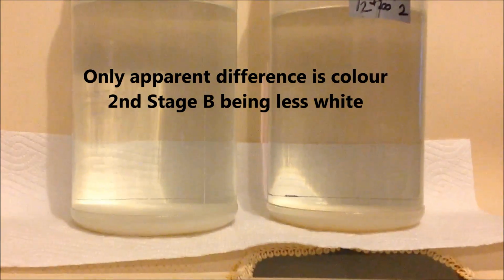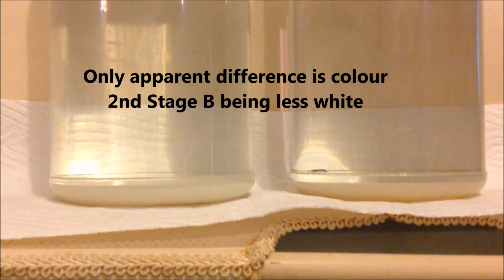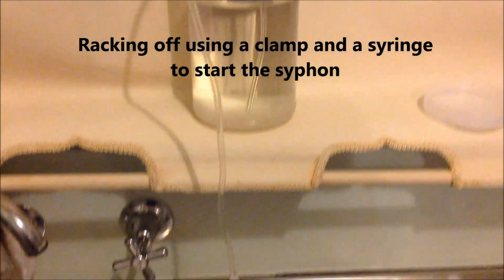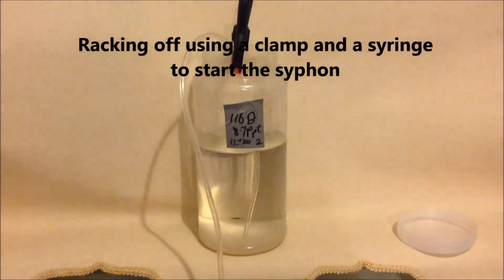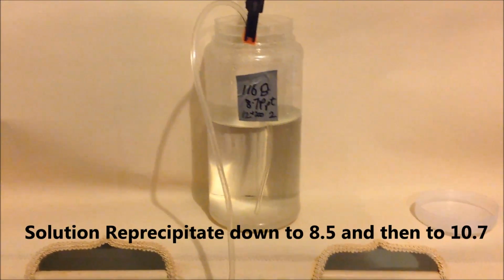So my choices at this stage are to rack it off, and I've decided I will rack them off. That's what I'm doing now. And the solution I'll take back down to 8.5 and back up to 10.7 and see what I get between the two.